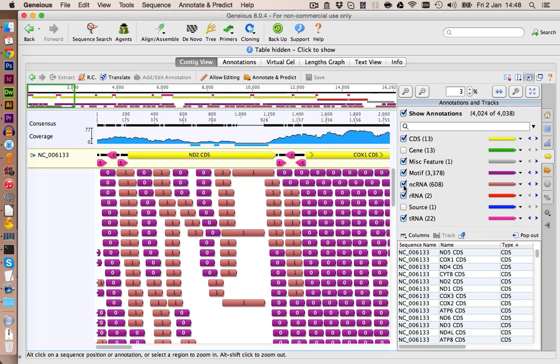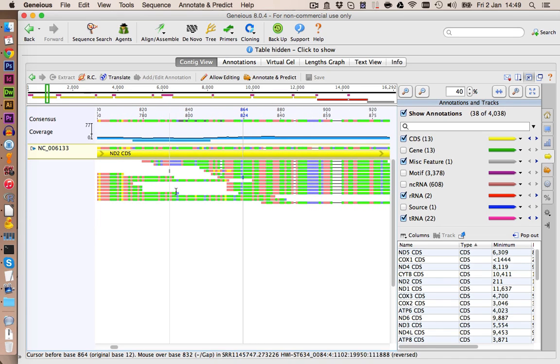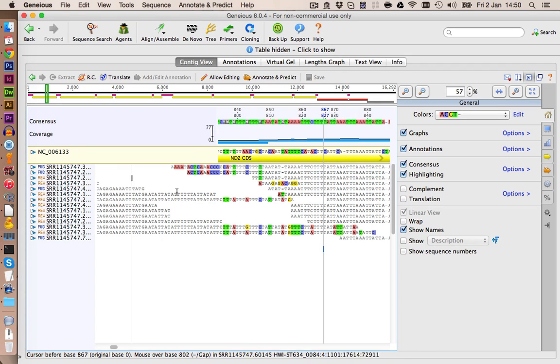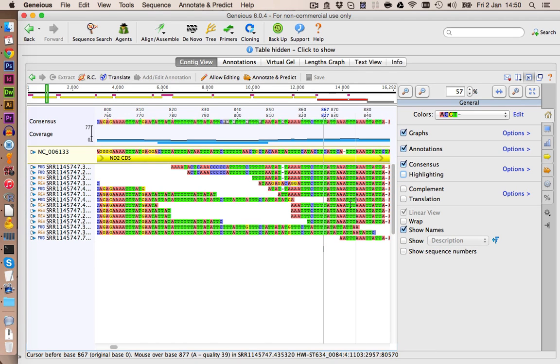Let's again uncheck the annotations here and zoom in to this one to check if this is assembled correctly. Let's turn on highlighting. And you can see here that this maybe is not correct. So it's probably better to delete those sequences from the assembly because they are not matching very well. If you would keep them, we would have wrong sequences in our draft genome, and BLAST would find even more wrong sequences which are not of mitochondrial origin.